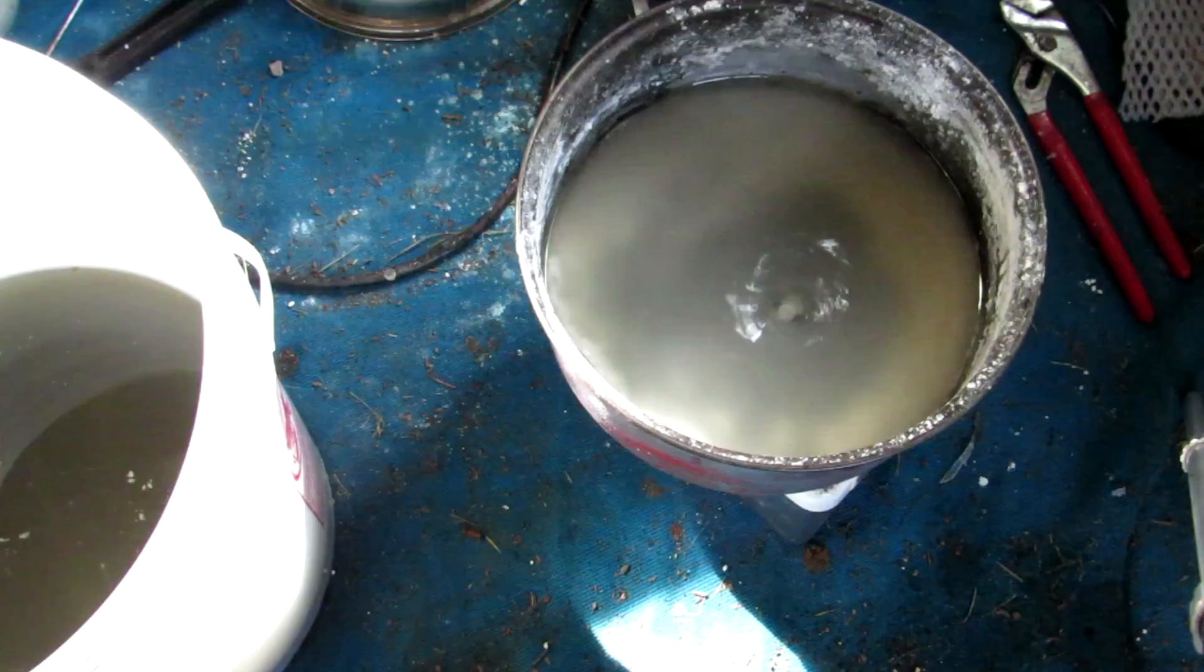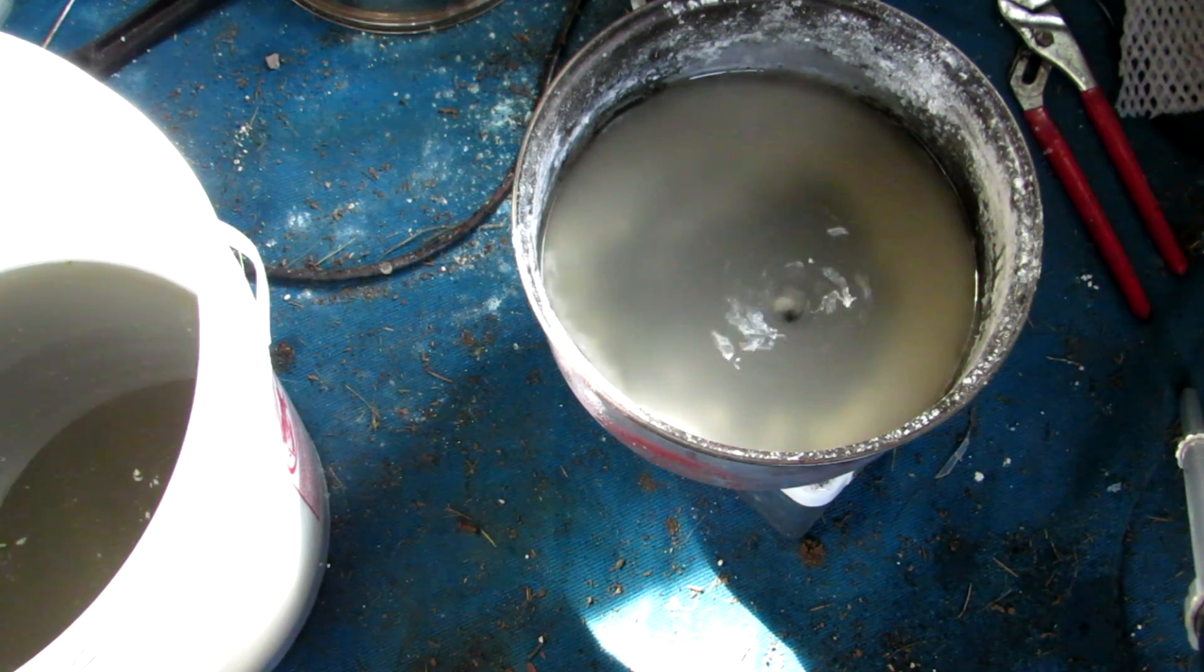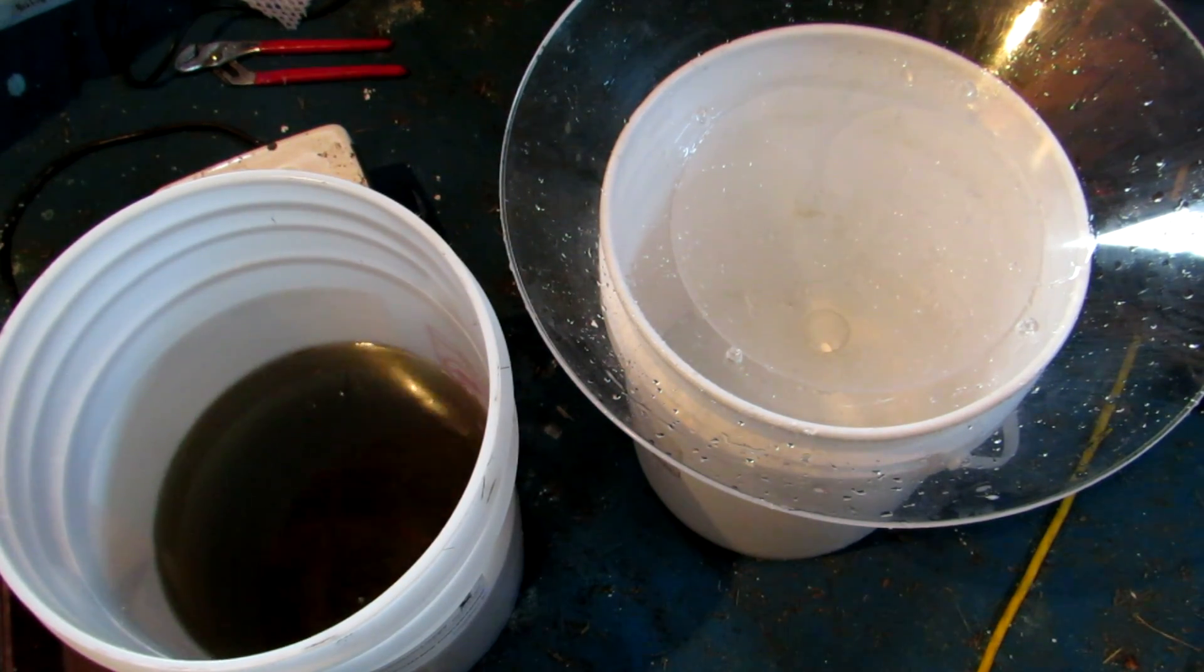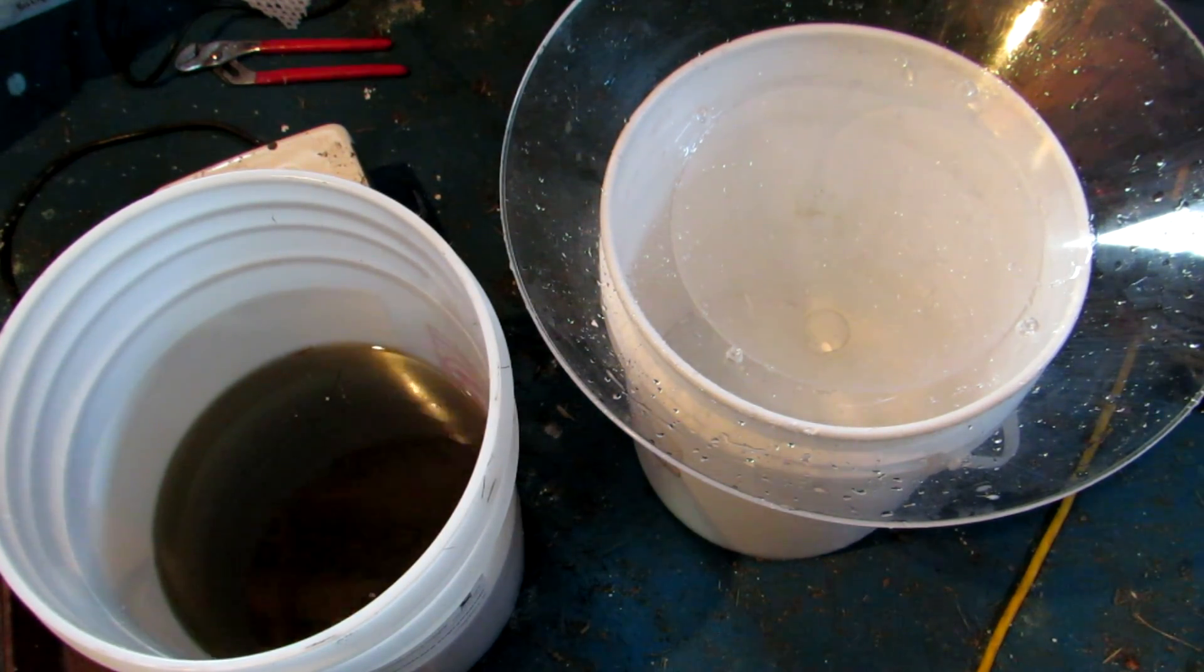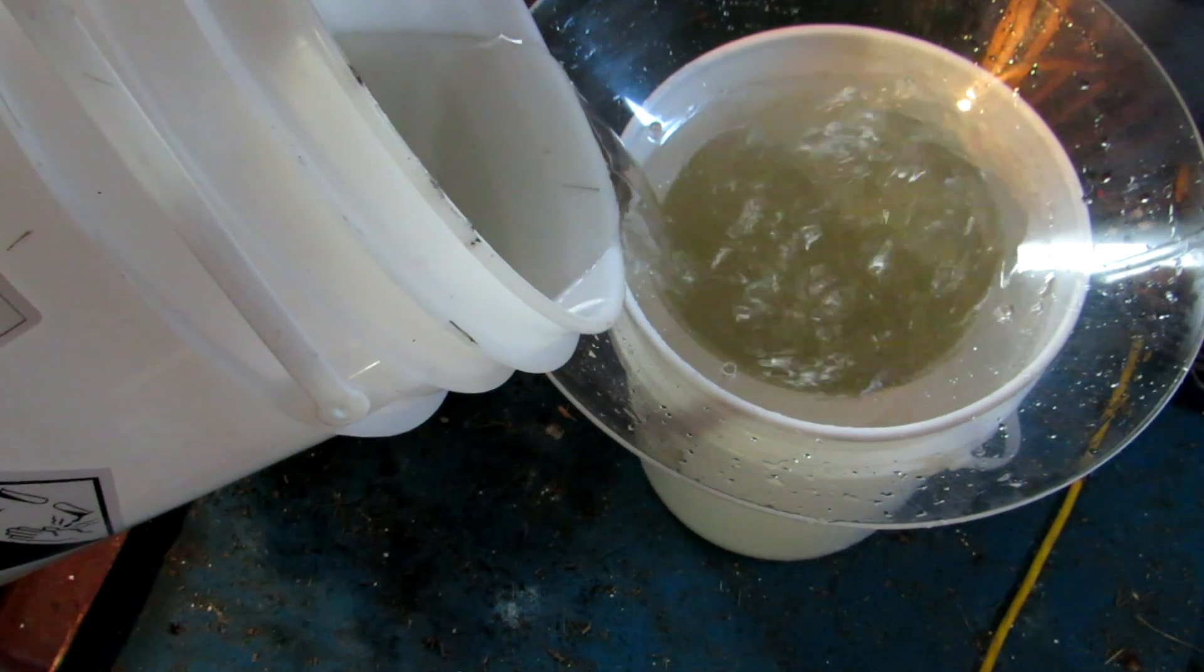Once cooled, lots of water could be added to the mixture to dissolve the sodium silicate. The solution could be left to sit for a bit so that unreacted silicon dioxide settles out, and then the mixture could be decanted and filtered.